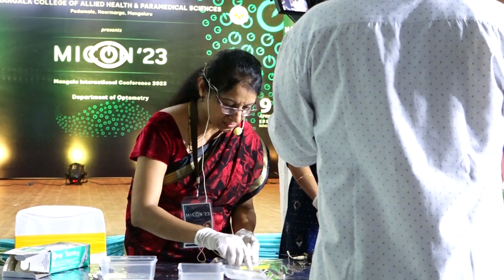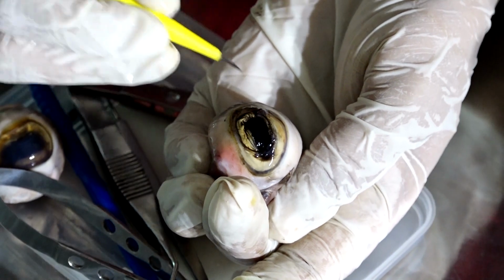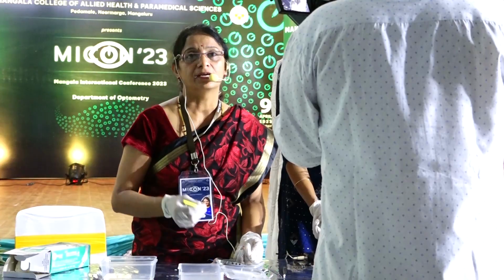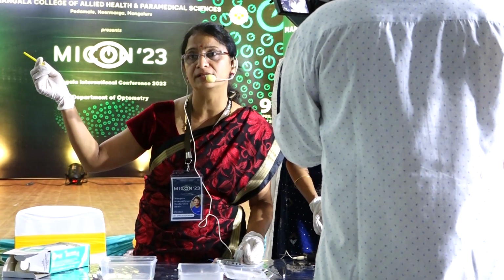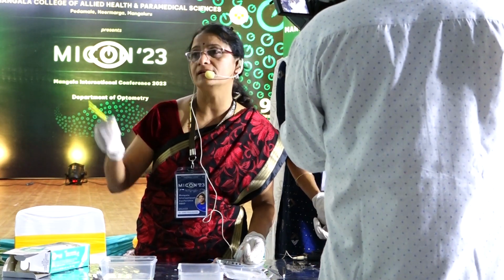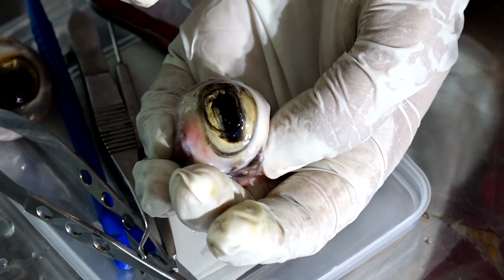And what you are seeing here is the iris. The color of the iris is different in different structures. Can you just show the next? Yes. In humans, there are different colors for the iris. You can have a brown. In Indian iris, it's brown. And in the Western countries, you can have light colored iris. Here, the goat's eye is also very light colored.